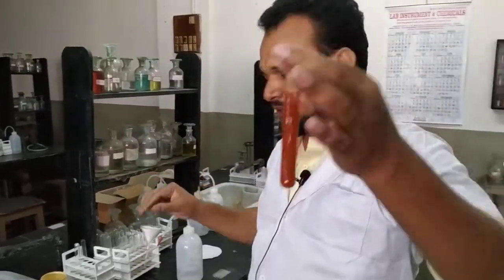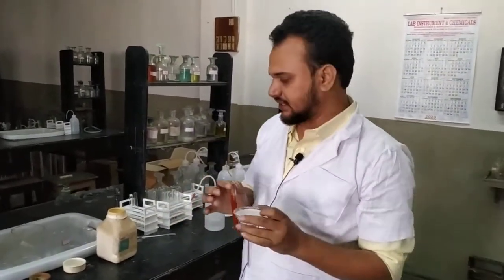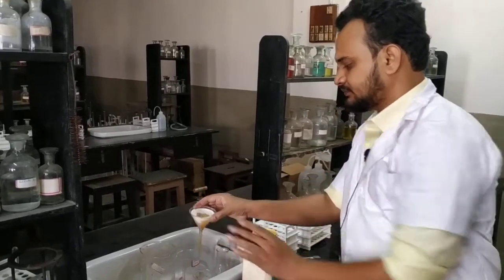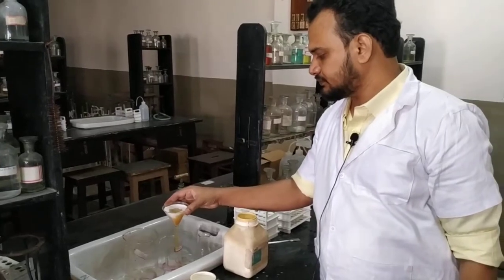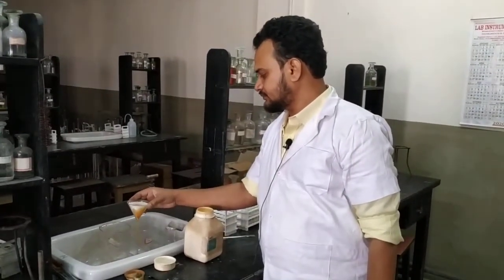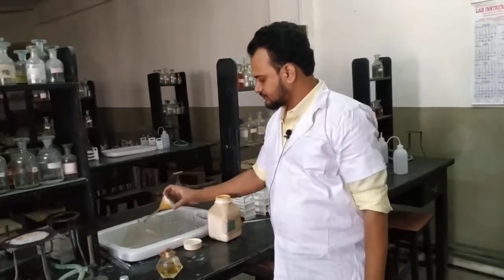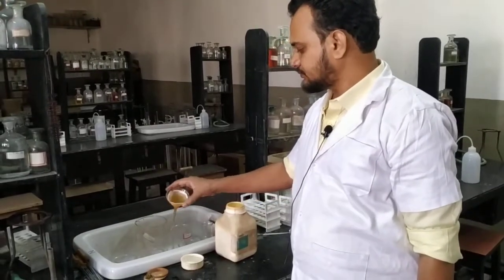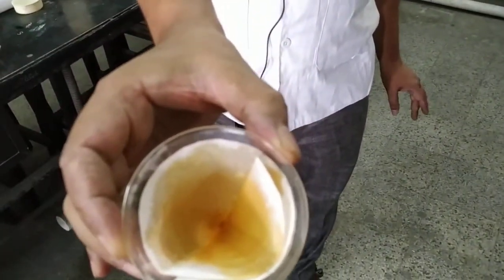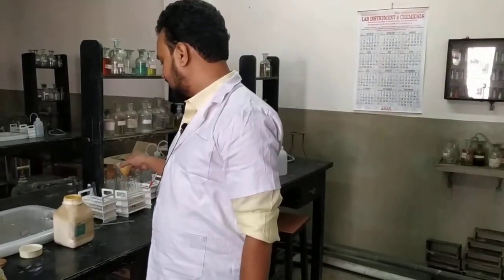If you are not sure about the precipitate, it is always suggested that whenever you have to observe the color of a precipitate, filter it out. Now you can clearly see the buff colored precipitate on the wall of the filter paper.